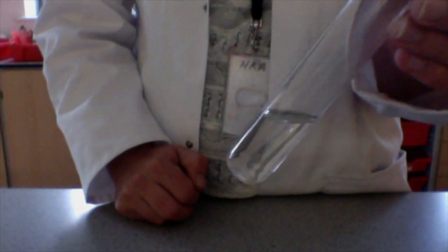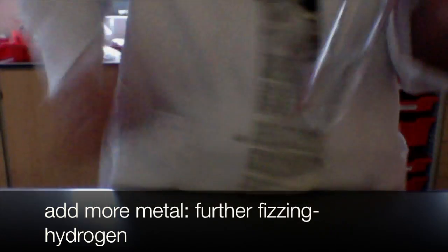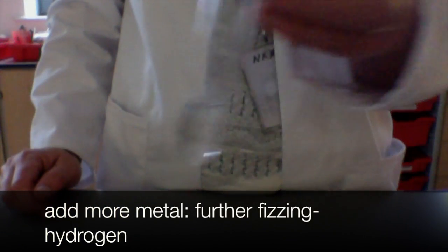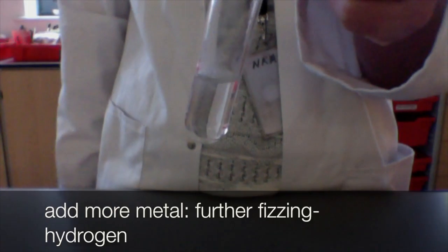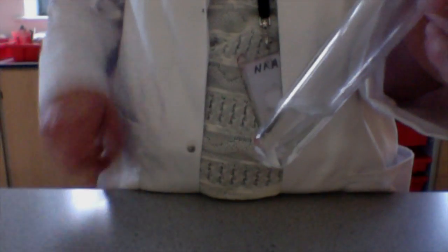So it's reacted and there's no longer magnesium metal in there. However, we still have some acid left over. So if I add some more metal, you'll see that it fizzes again. We've still got some acid and the acid is reacting with the metal, producing hydrogen. You would need to keep adding that metal until it stops fizzing.